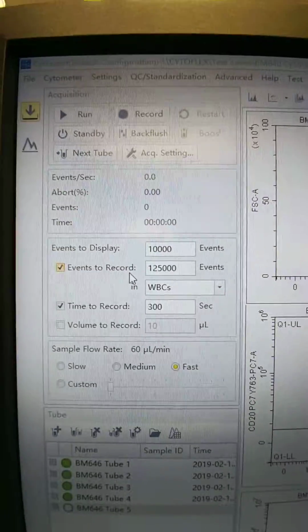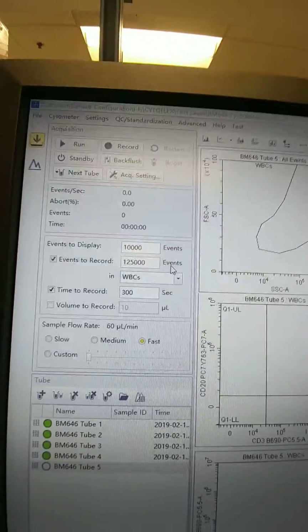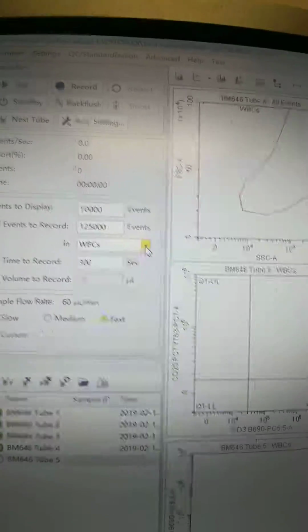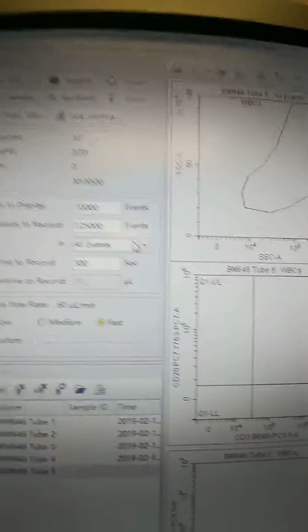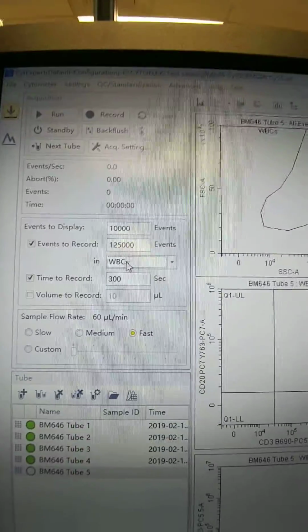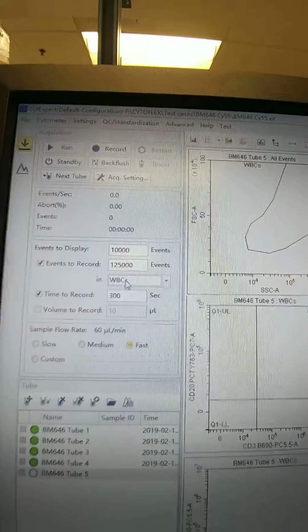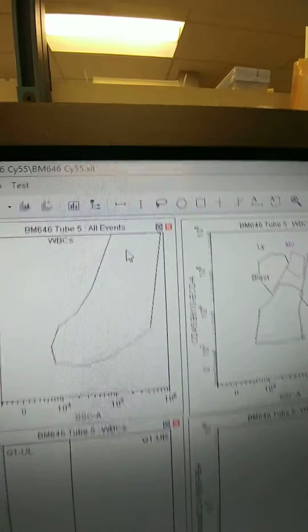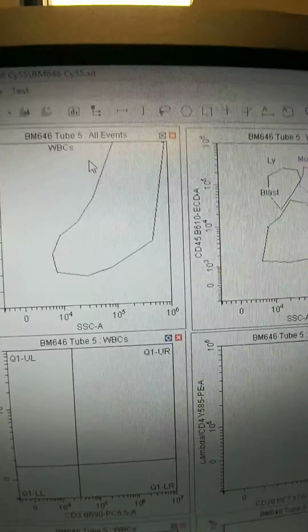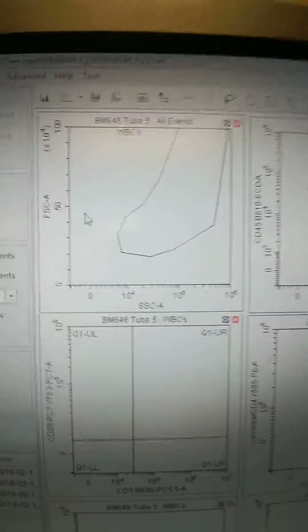One thing I mentioned in an email to some of y'all, I may not have done it when I was there, but under events to record, I like to have it at 125,000 events, but make sure you change this box. I probably left it defaulted to all events, so change that to where it's looking at WBCs. That way it will continue to collect events until you have 125,000 events in this WBC gate, whereas otherwise it would just collect 125,000 total events, whether it was in this gate or down here or over here, whatever.